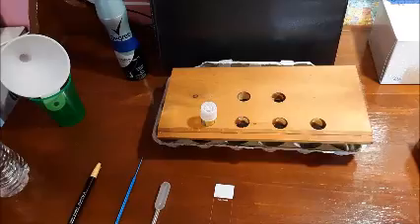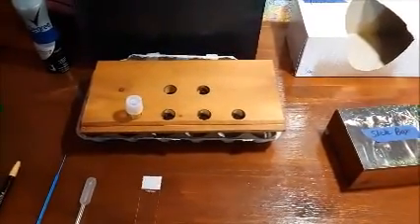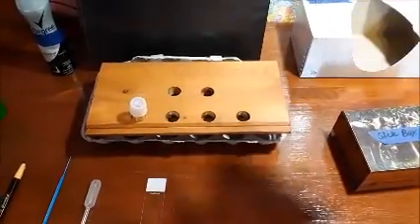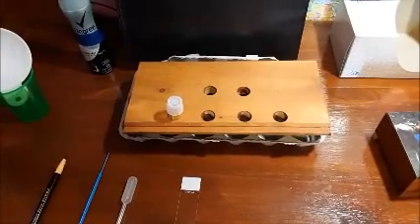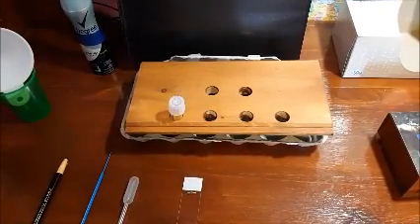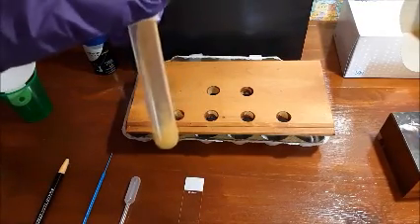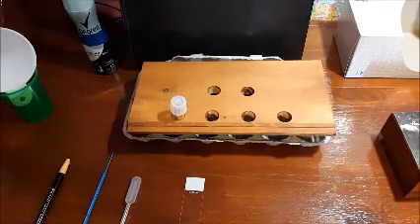And you're also going to need a slide box, which is right here. You're also going to need a biohazardous waste container, which is the tissue box in the back. Well, the tissue box is going to represent the biohazardous waste container. And then you have your slant culture right here, which has your unknown bacteria in it. So, alright, let's get started.